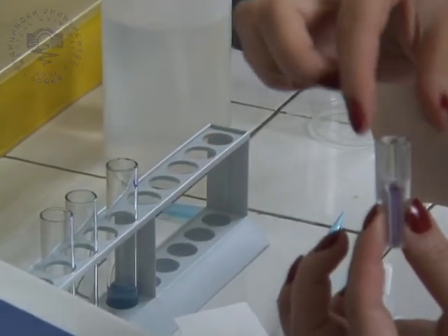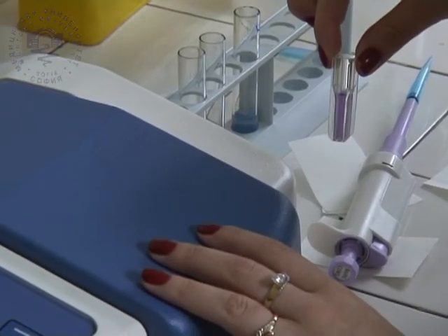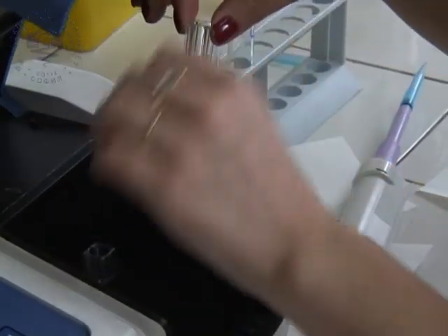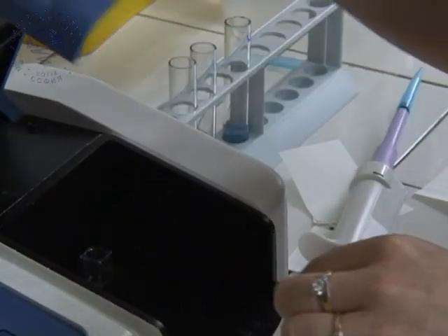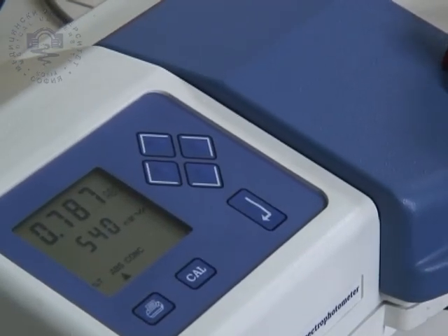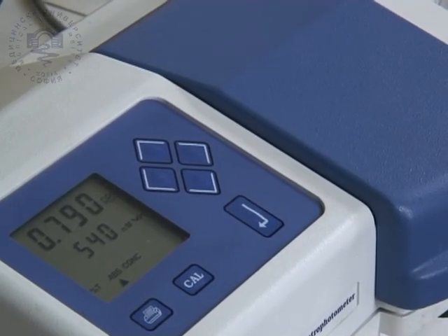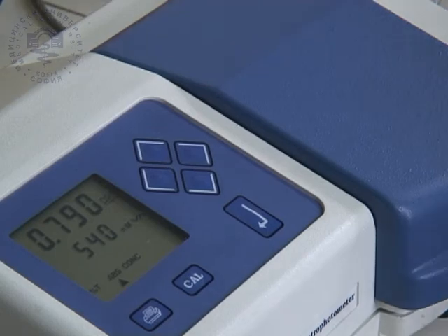The spectrophotometer is calibrated to measure absorbance at 540 nanometers. First, the device is calibrated with the control sample. Then, the solution studied is poured into a cuvette, which is placed in the spectrophotometer. The lid is closed, and the absorbance is displayed.